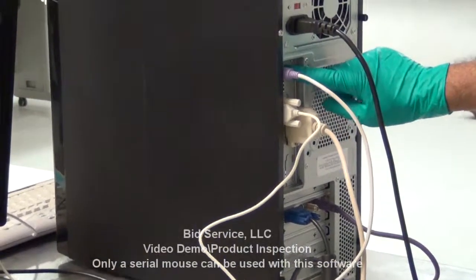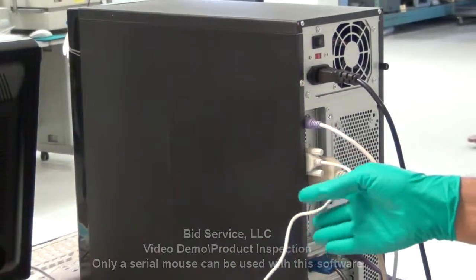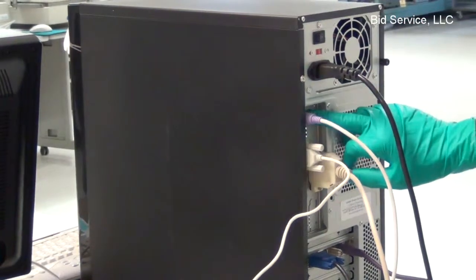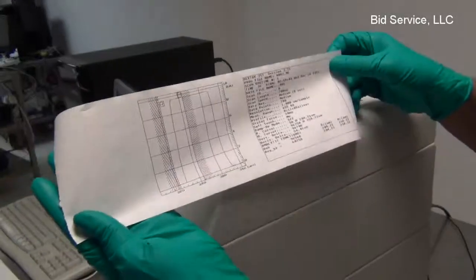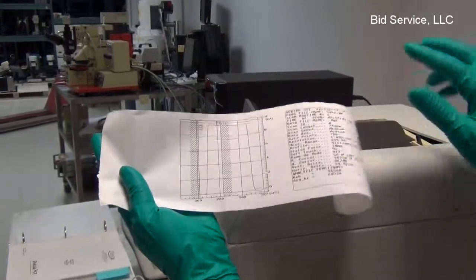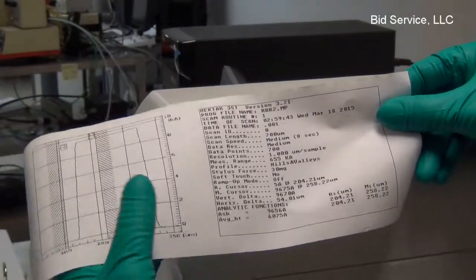And never a regular mouse should be attached to this unit. The software is designed in such a way only a 9-pin serial mouse is to be used on this unit. So never put any regular mouse on this unit. So here is a printout displaying the graphics and the data plot.